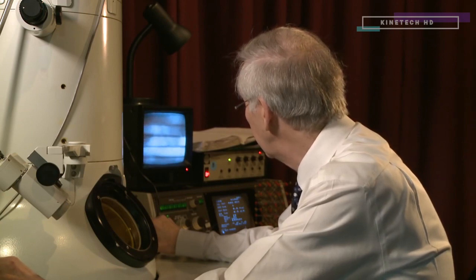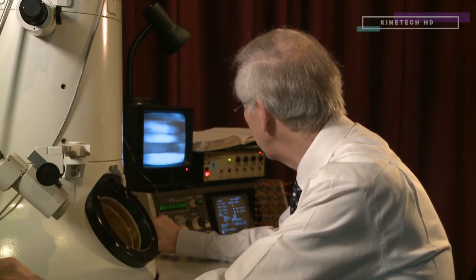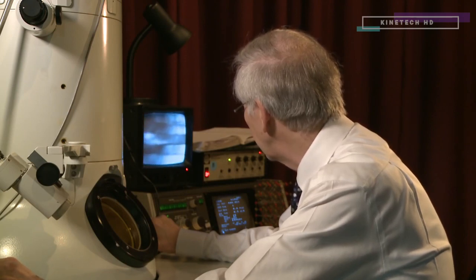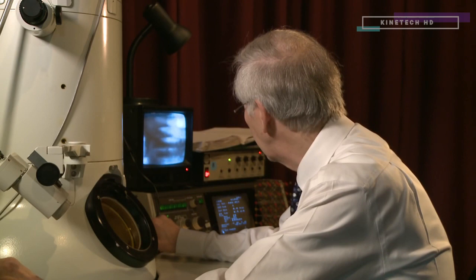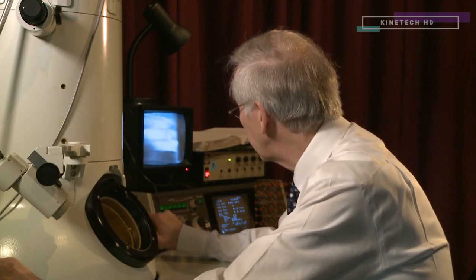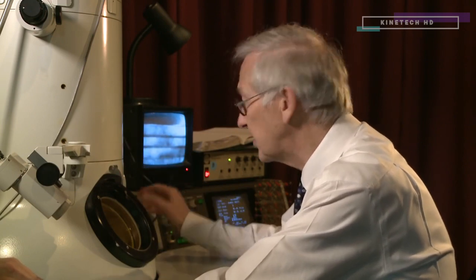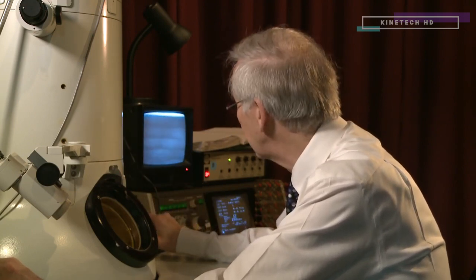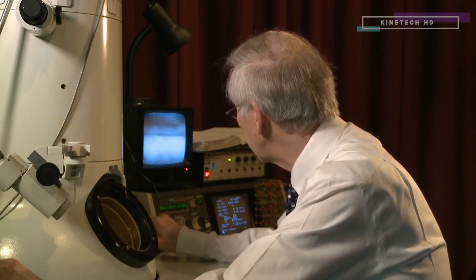I can just move along these quantum wells — just moving the specimen now — and we're interested in the quality of these quantum wells. You can see some imperfections in the quantum wells as we move along, and we are reporting back to the growers some of these imperfections so that we get much more efficient LEDs. But without the electron microscope, we couldn't even see these quantum wells — no hope in an optical microscope. So this microscope is absolutely essential for seeing these quantum wells and for developing this low energy lighting from LED materials in our homes and offices.